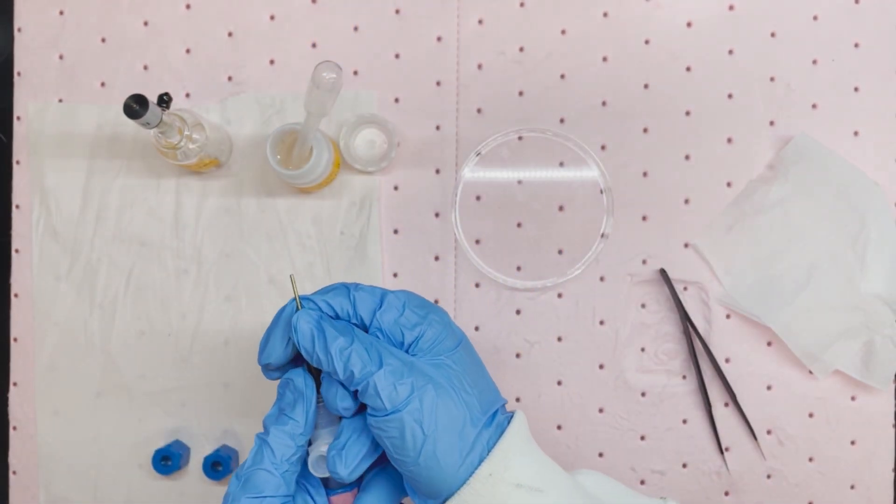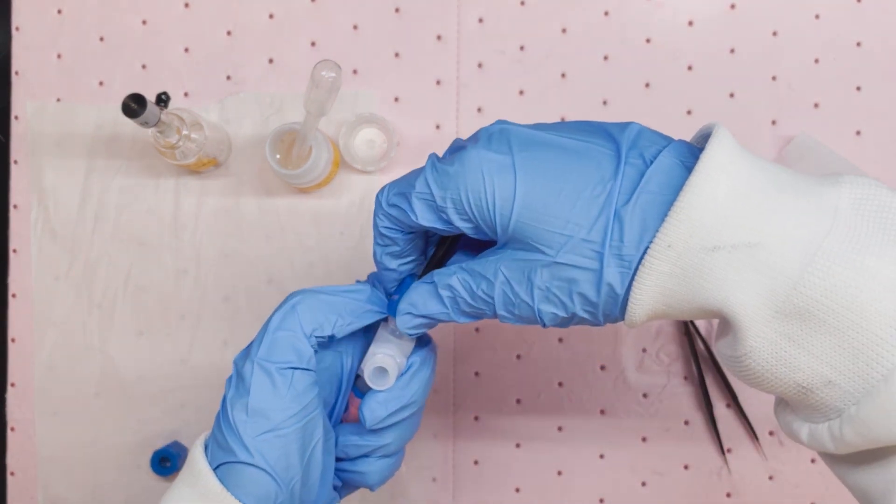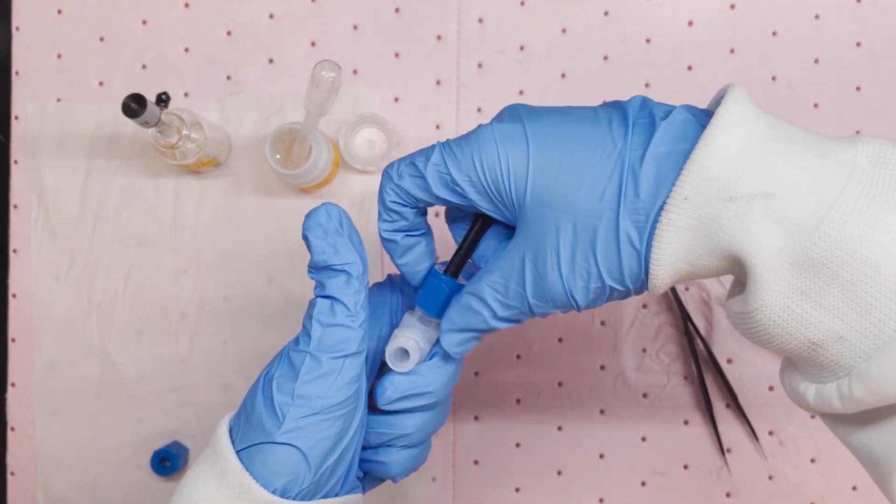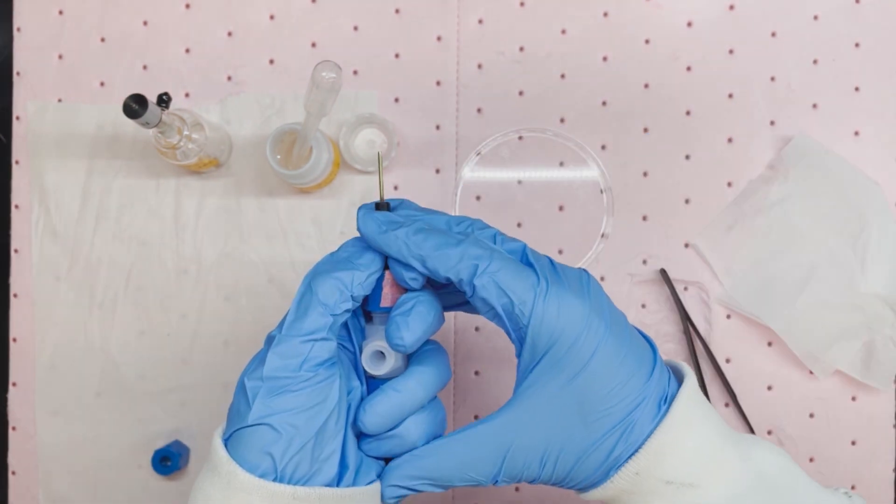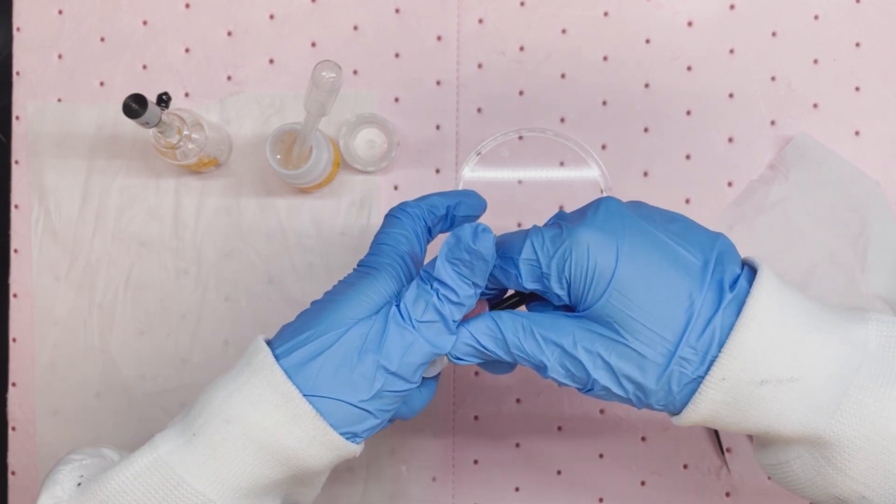Holding the two electrodes firmly against each other and put the cap on, keep pressing on the electrode while screwing the cap. Then, tightly screw the cap on the working electrode side while keep pressing on the electrodes against each other.